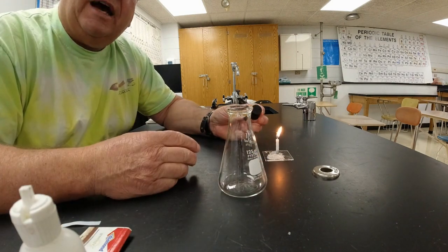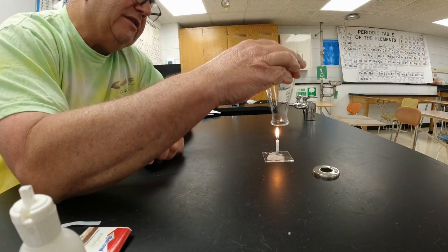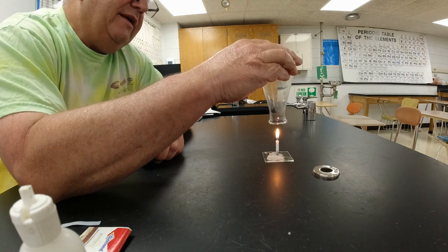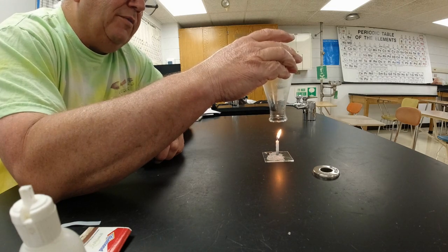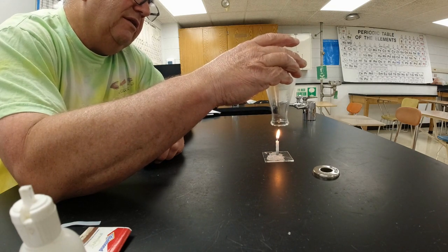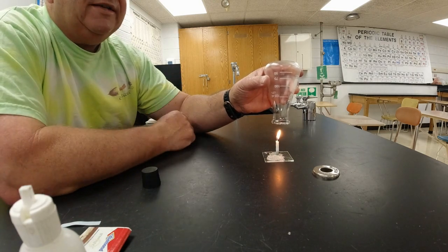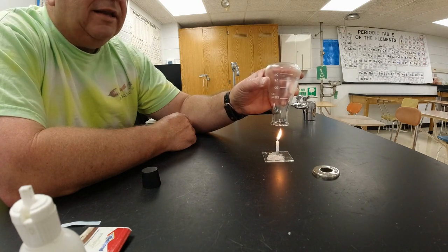All right. So I have a rubber stopper to put in the flask. I'm going to put this flask over the top here, and I'm going to collect some gas. I'm not trying to make it cloudy, although it is a little bit turning cloudy in there. I don't want to smother the candle, so I'm just putting it over the top. Hot gases from the flame, if there are any being produced, are going up into the flask. I'm going to hold this over here for about a minute or two, and I'm collecting gas there. If I look at the flask, it's getting kind of cloudy, and that we already saw was from that condensation before. It's the same kind of thing, but we're not testing for this. This time we're going to test for a gas, specifically carbon dioxide, because that's what lime water tests for.